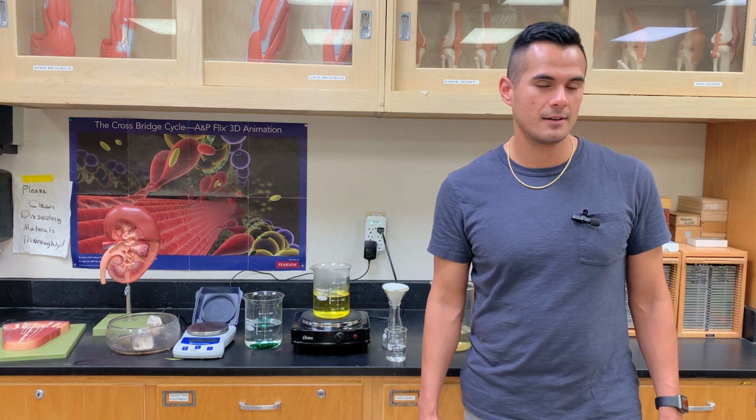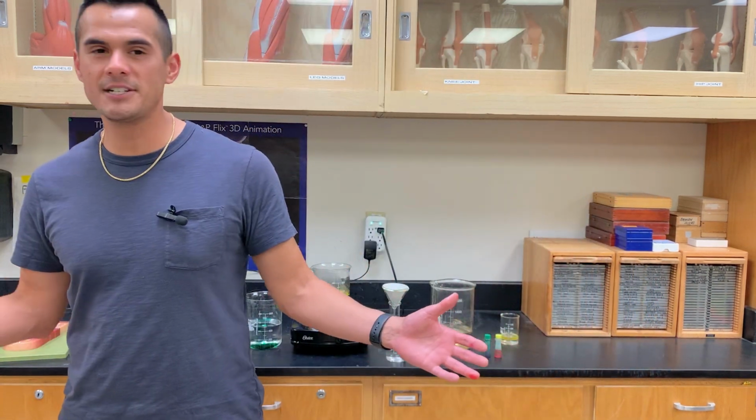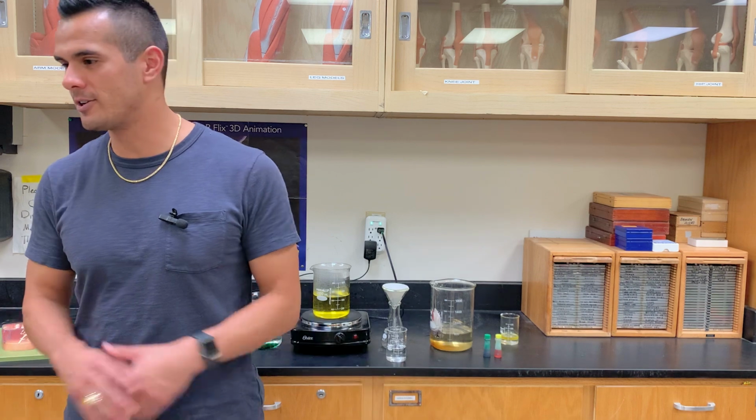All right, so were our predictions correct? Yes. Yes, they were correct.